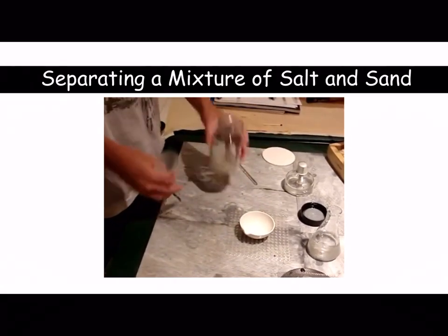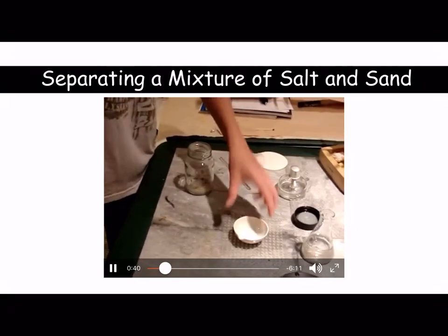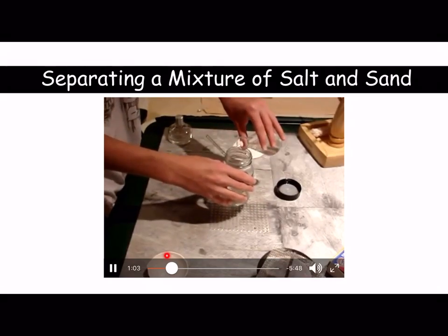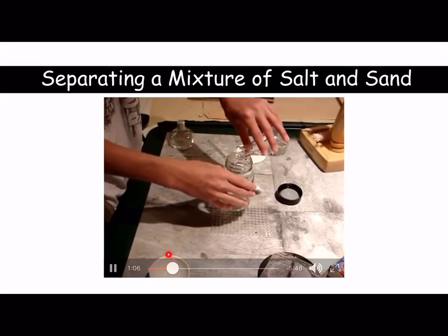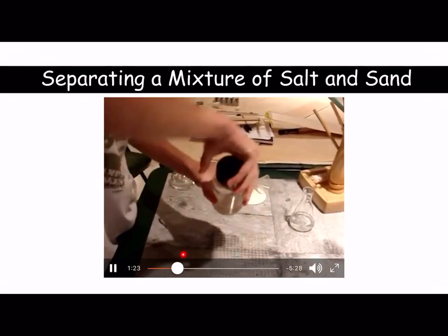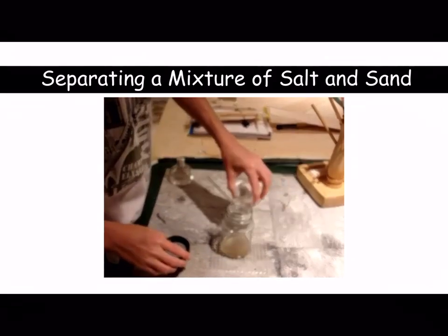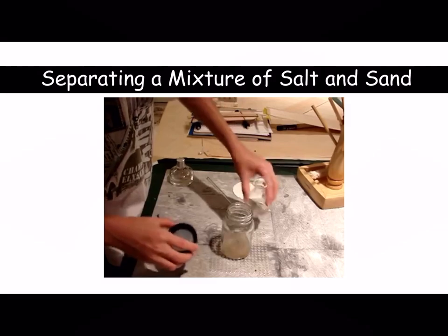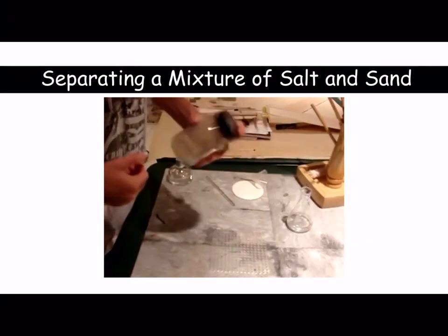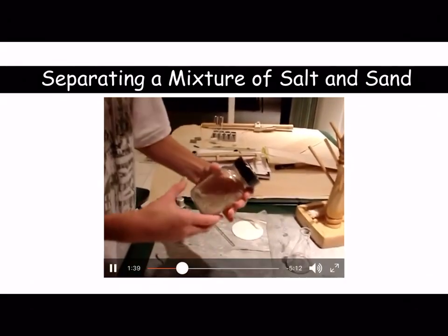So the first thing, as you can see here, guys, I'm just going to fast forward it a little bit, is you would add your water into your sand and salt mixture, mix it, give it a good shake so the solution is homogeneous, and we know the word homogeneous means the same throughout, so the salt is evenly dispersed in the water. Give it a good shake there to dissolve it, make sure it's homogeneous.